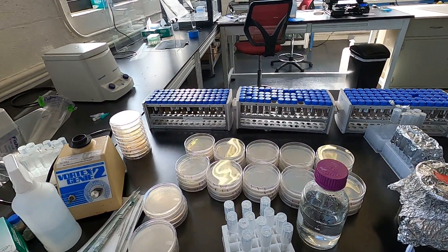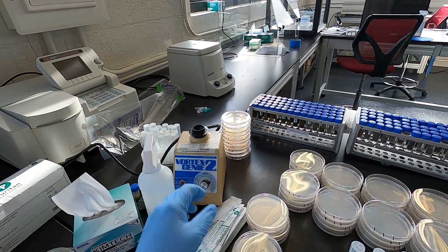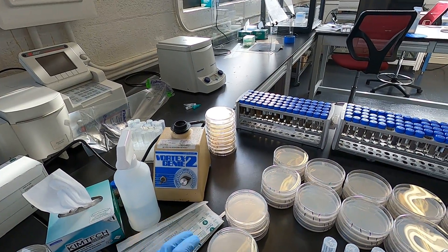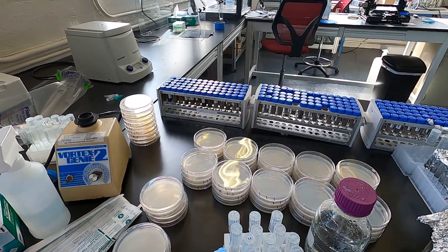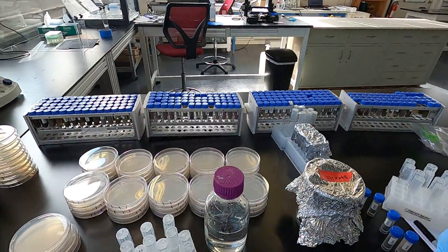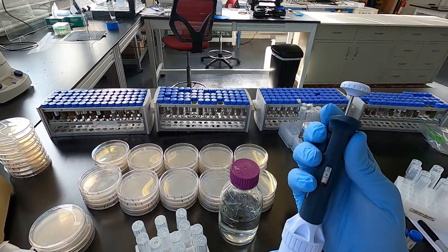I already cleaned the area with 70% isopropyl alcohol. Other good things to have around are a vortexer for mixing your sample, cotton tip swabs for spreading the sample, your plates pre-labeled with the dilution series you want, and test tubes which we are going to fill with 0.85% sodium chloride.